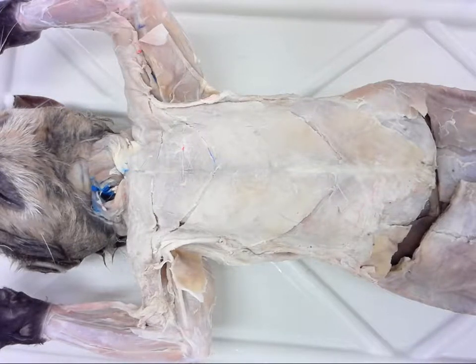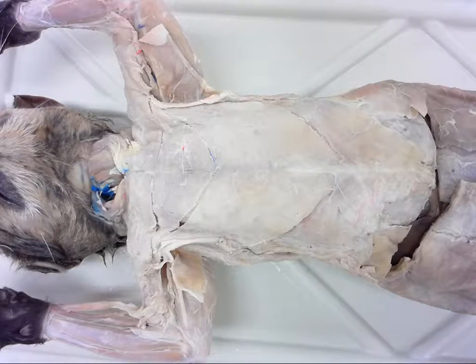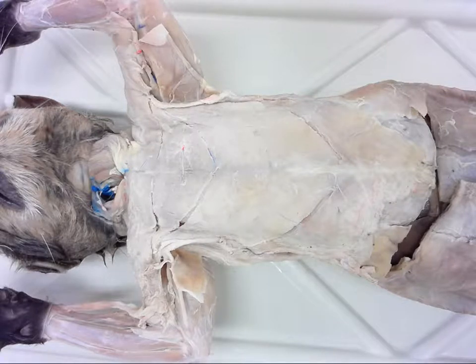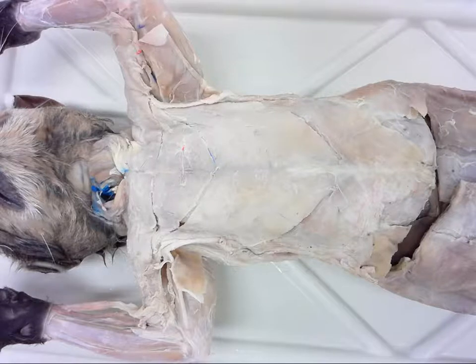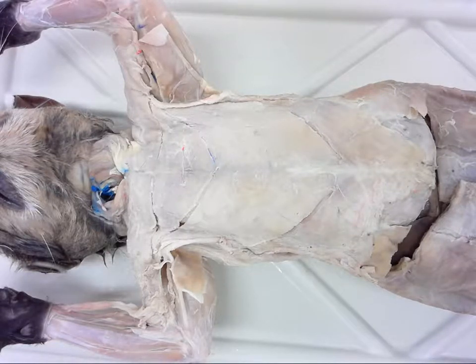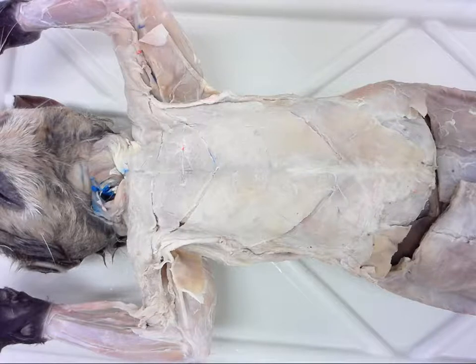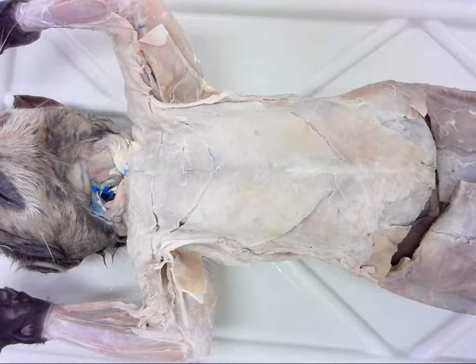Welcome class to quiz number two of the muscular system. Hopefully you did well on the first one. I was randomly covering a variety of areas we have gone through, so make sure you are reviewing your structure list. Just because I don't identify something in the videos doesn't mean it will not be on your lab final. Refer to that for a comprehensive list.